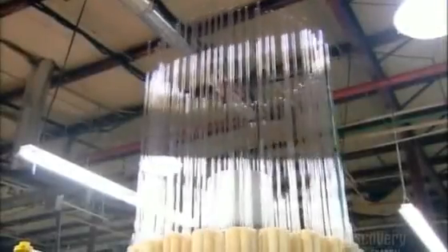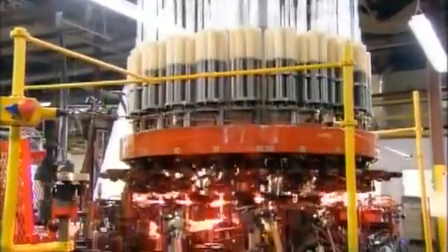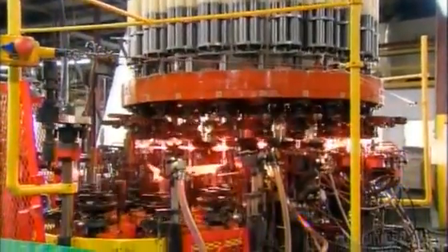This production line makes vials. These gizmos, called top turrets, feed large glass tubes into a machine. First, a punch-out burner heats the end of the tube to create an opening. Then a steel pin widens the hole on the upper part of the vial.